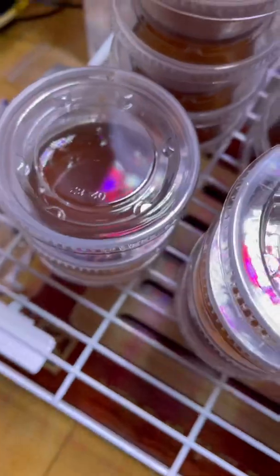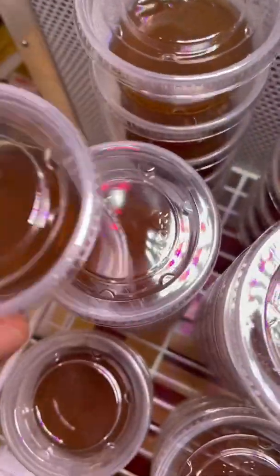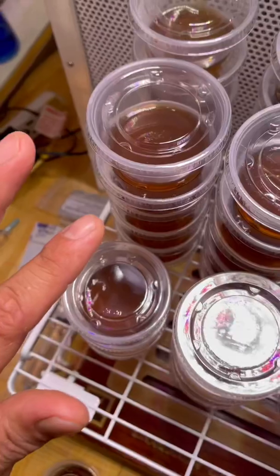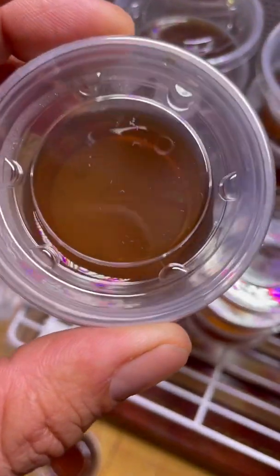But if you see this, look, no condensation. This is the important part right here, because you don't want your condensation just dropping onto the agar. So this will work as a window, so you can see how the mycelium is growing.